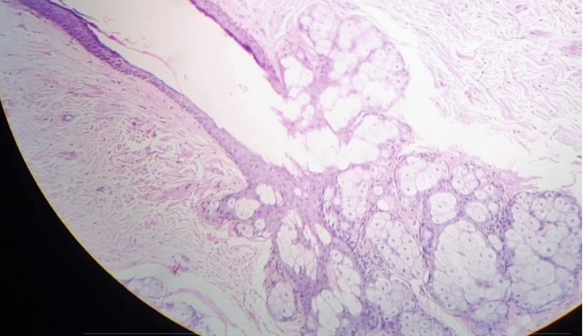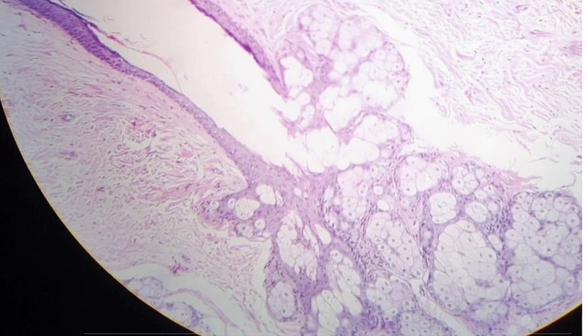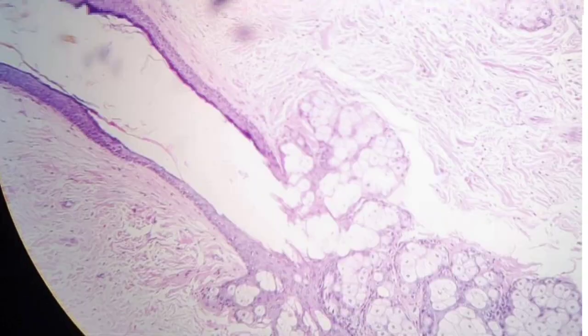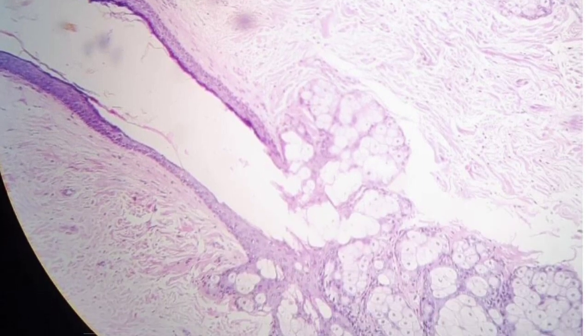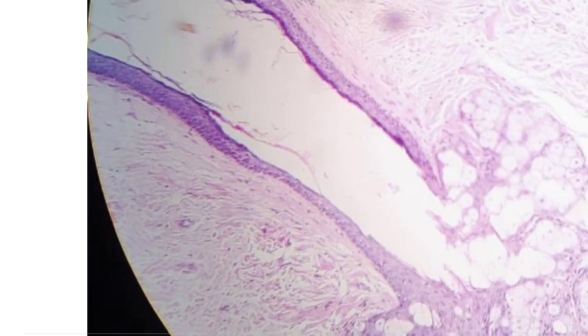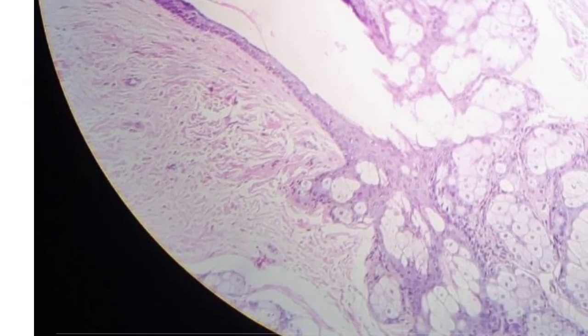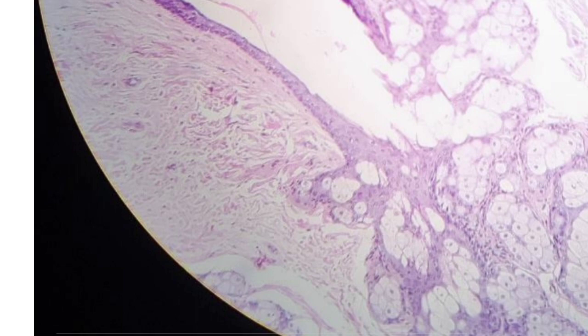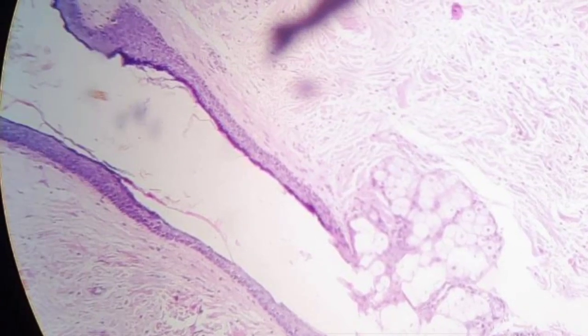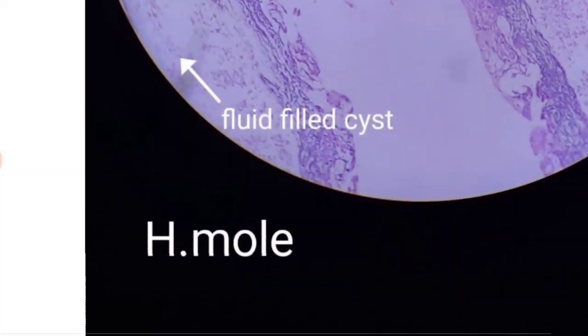The benign cystic teratoma has a cyst wall and a solid prominence inside called the Rokitansky protuberance. Tissue elements include tooth, bone, and cartilage. On microscopy, you will see a kaleidoscopic appearance with keratinized stratified squamous epithelium, sebaceous glands, and hair follicles. Other components like bronchus, intestinal epithelium, cartilage, bone, smooth muscle cells, neural tissues, and salivary glands can also be seen.